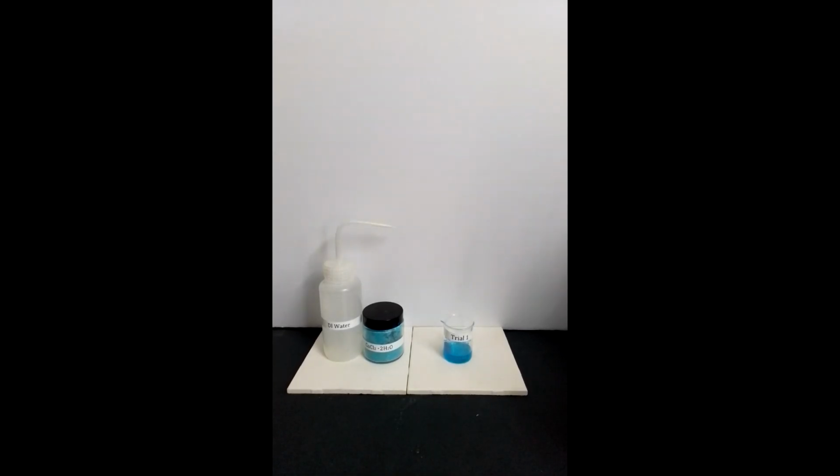The result is that a blue solution has been formed.